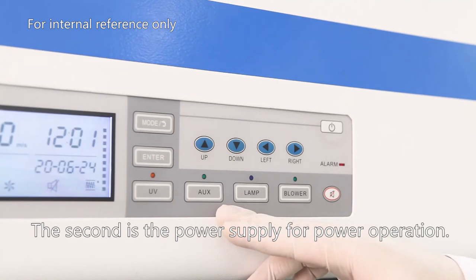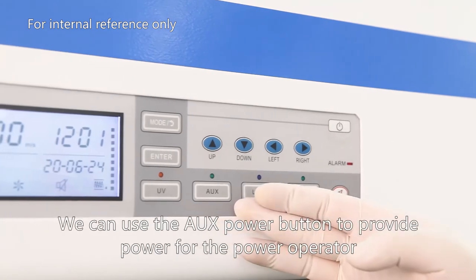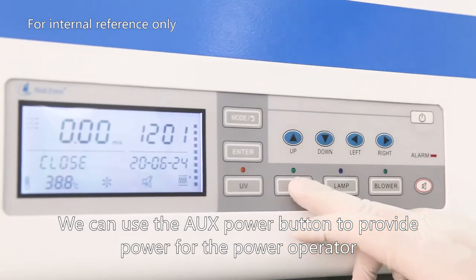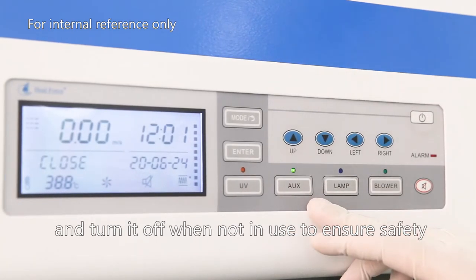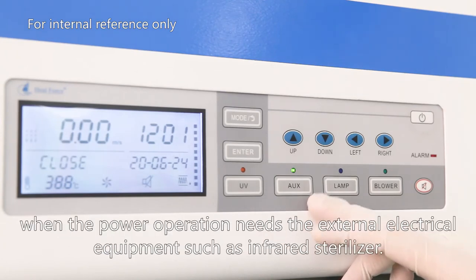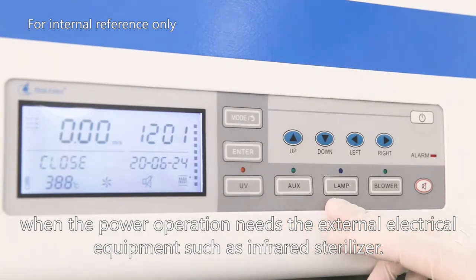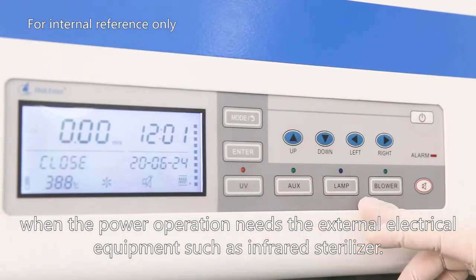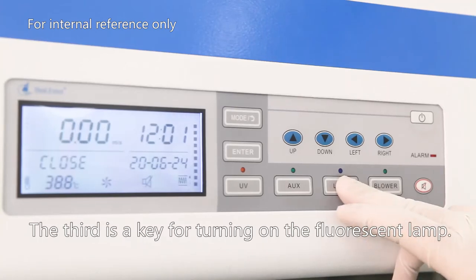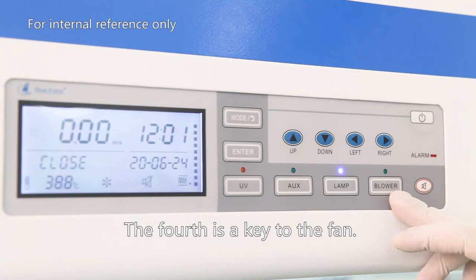The second is the power supply option. We can use the AUX power button to provide power for external electric equipment such as an infrared sterilizer, and turn it off when not in use to ensure safety. The third is the key for turning on the fluorescent lamp. The fourth is the key for the fan.